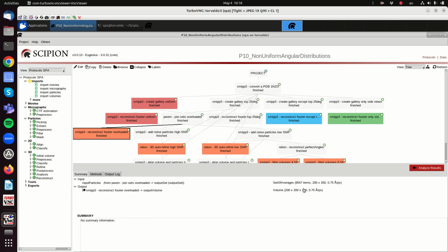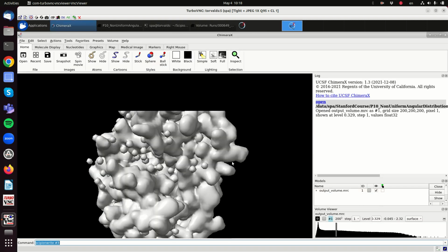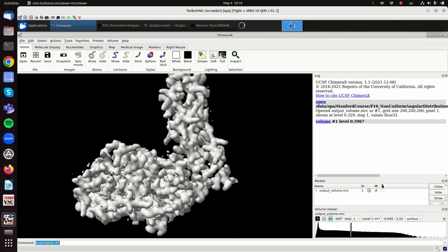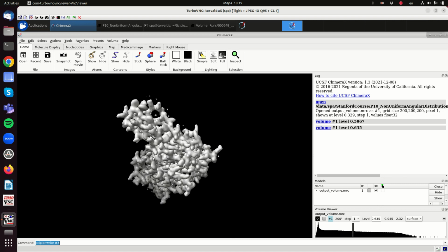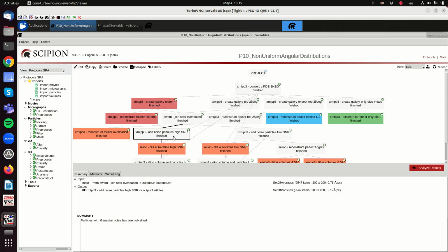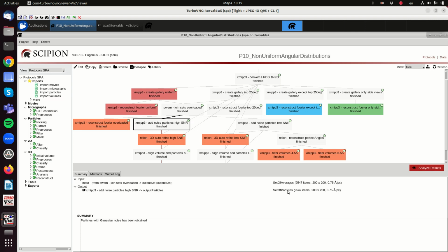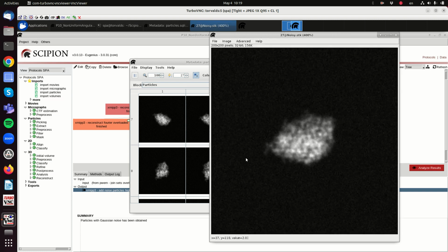If we now reconstruct with the full data set, we see the original PDB. No artifact, no elongation. We can check in 3D, but there is no elongation because we are fully covering the 3D space, and the reconstruction algorithm will give more or less weight to each one of the samples depending on how many samples are coming from that direction. So there is no obvious elongation here. There shouldn't be. And now let's add noise to the particles, because here we are using perfect angles. Let's add noise, but very little noise. These images are not perfectly clean, so there are fluctuations in the background. You see the numbers down here.